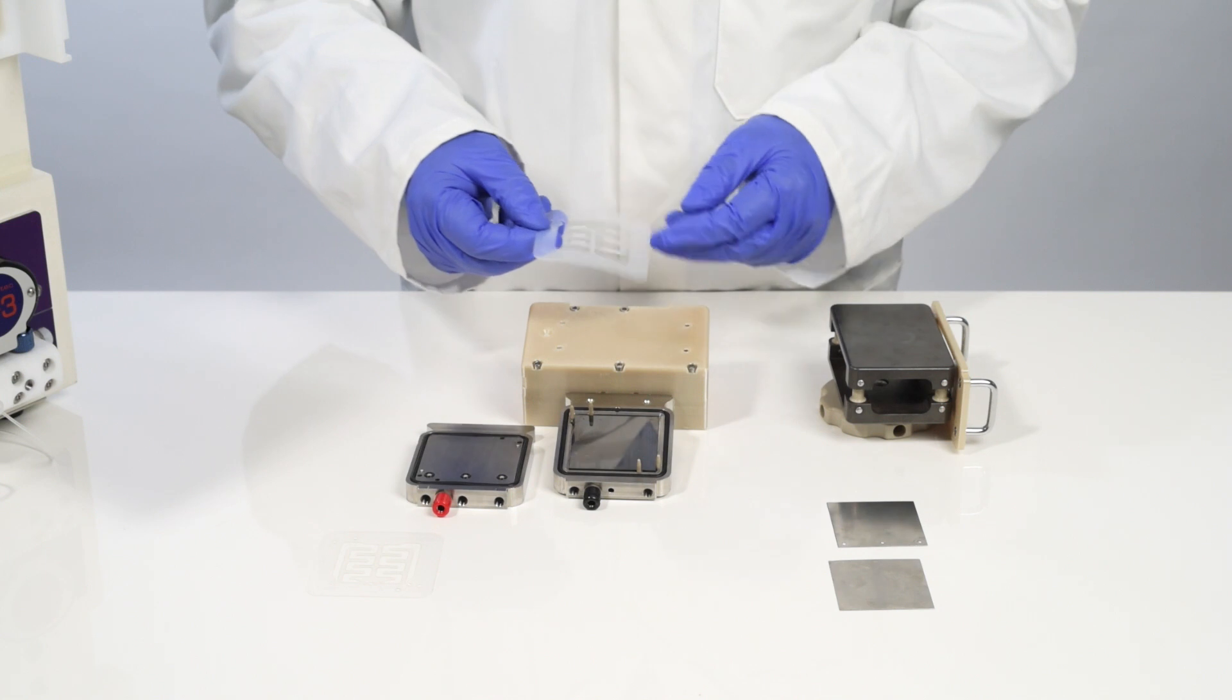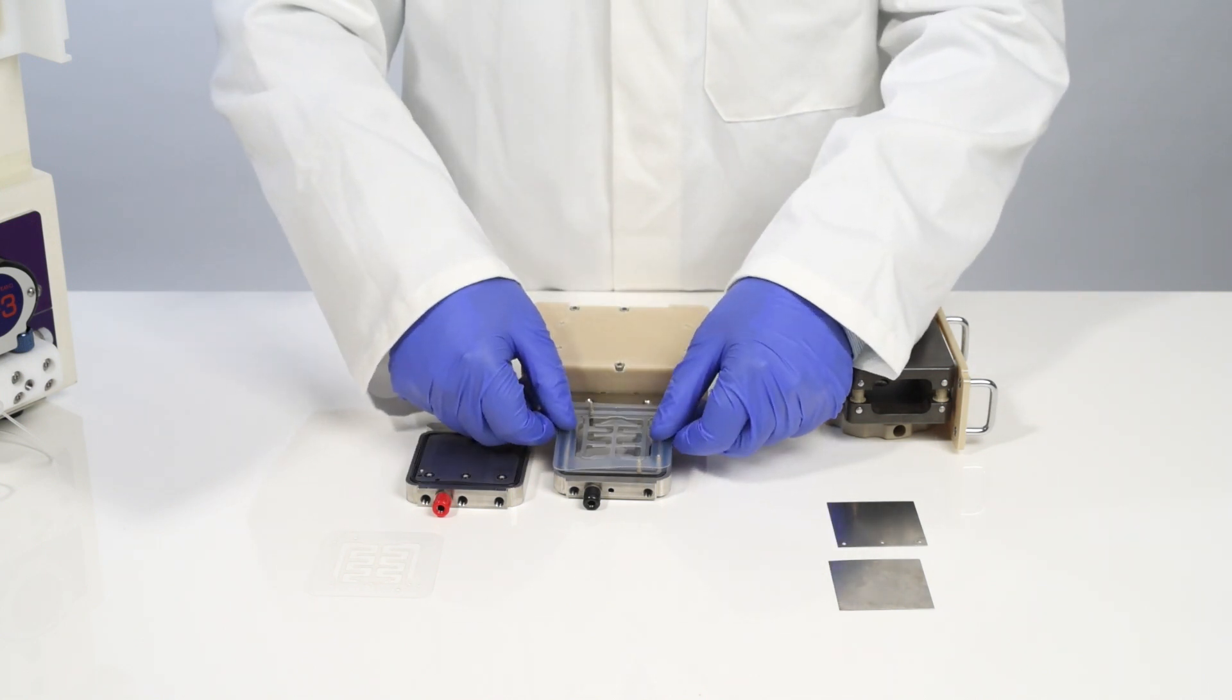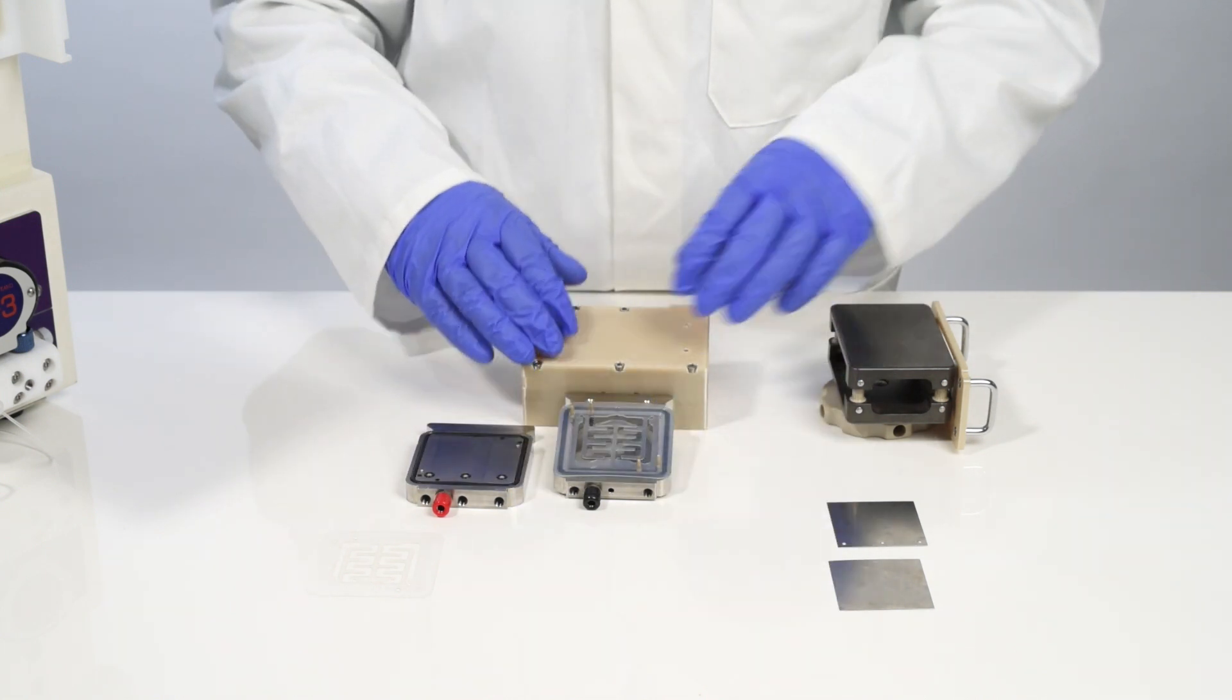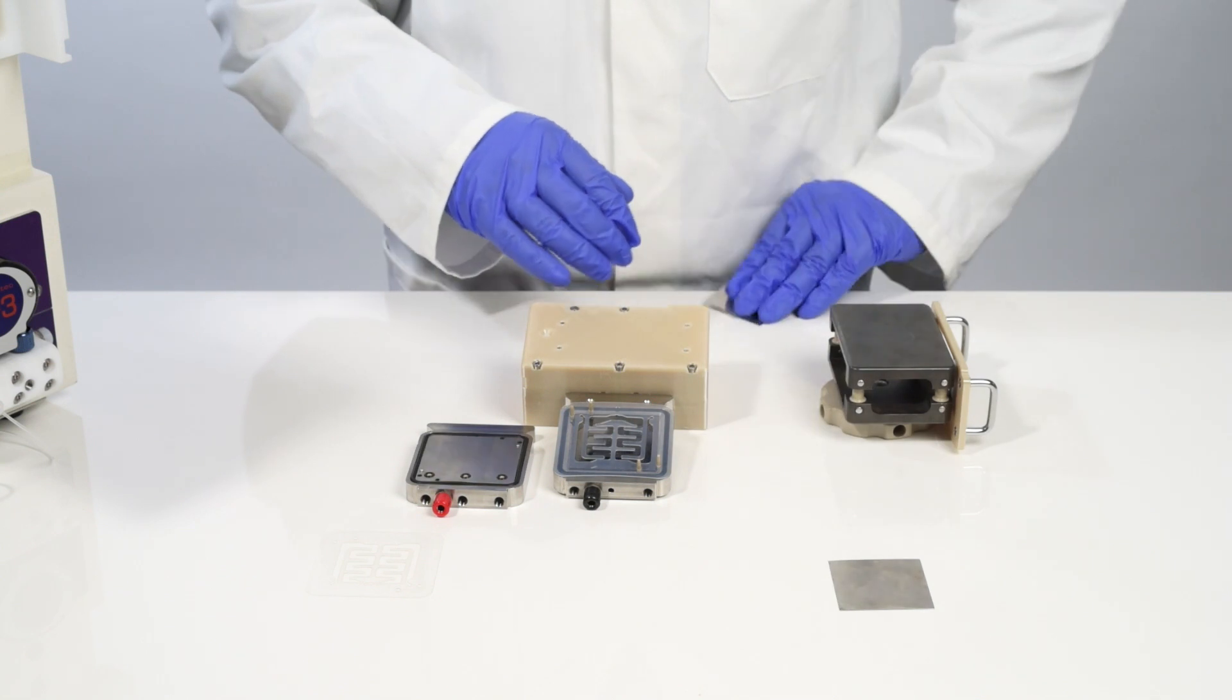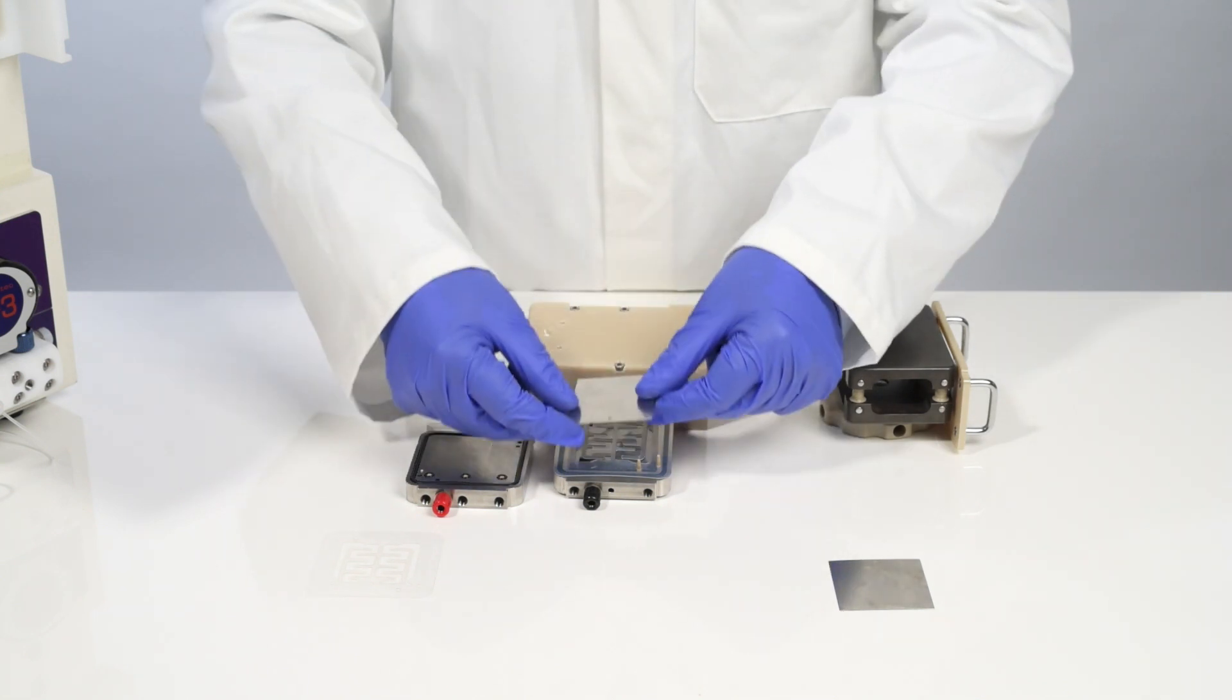Next I'm going to put in a different membrane and finally I'm going to replace the top electrode with the fluid inlet holes.